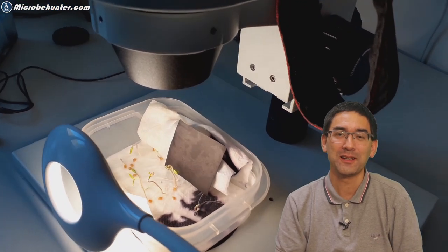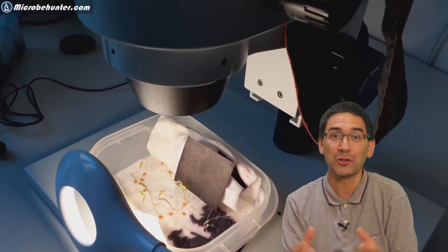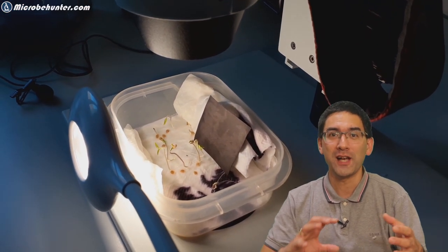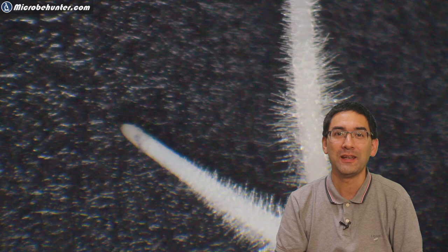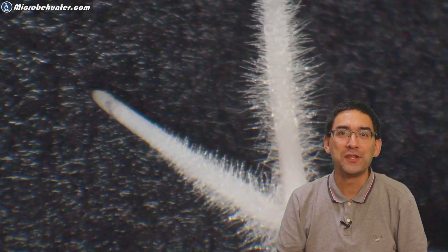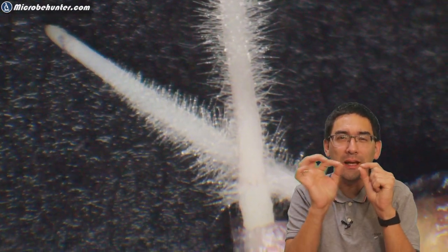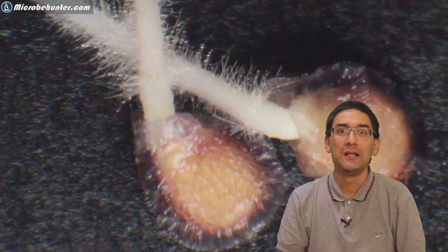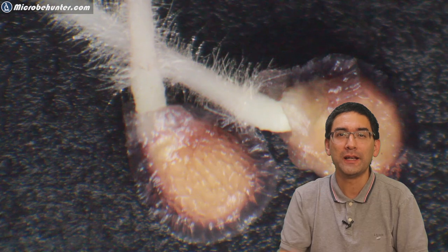I took the whole plastic container with the seeds which already started to grow and I put it directly under my stereo microscope. Of course I had to adjust all of the lights and everything. After a few days I could see that there were already many tiny little root hairs, and those root hairs are very very fine.